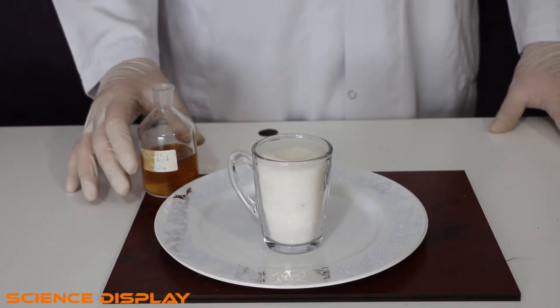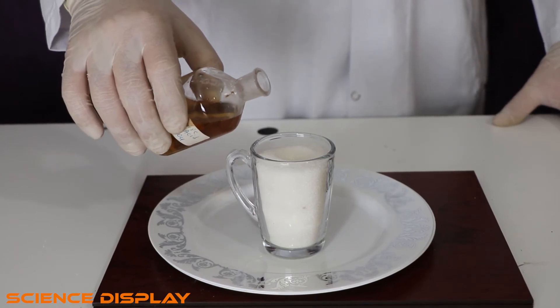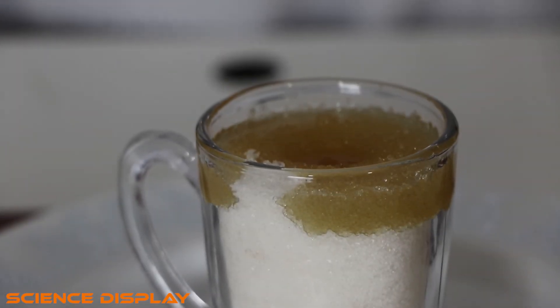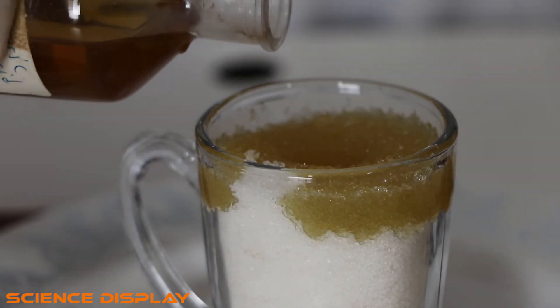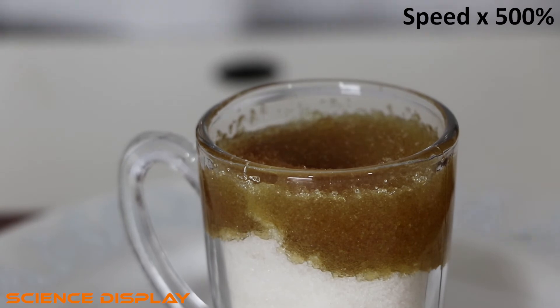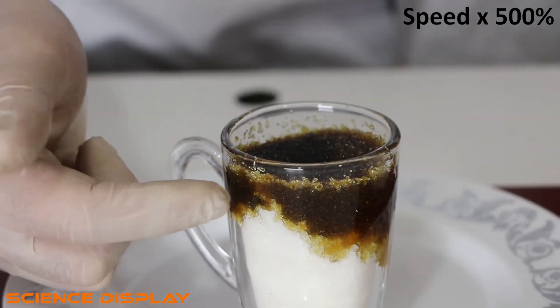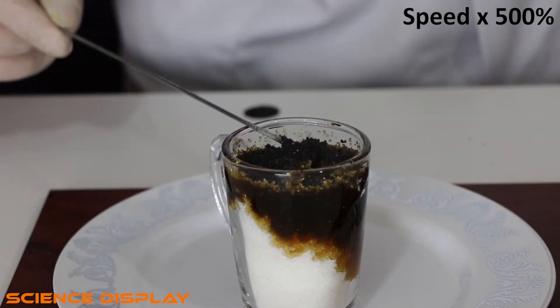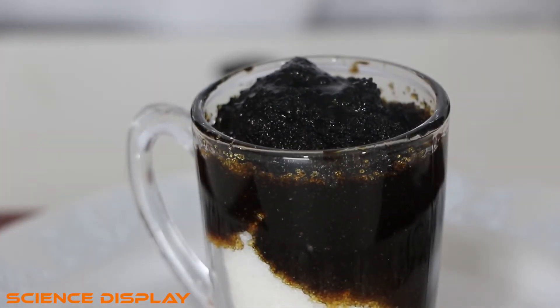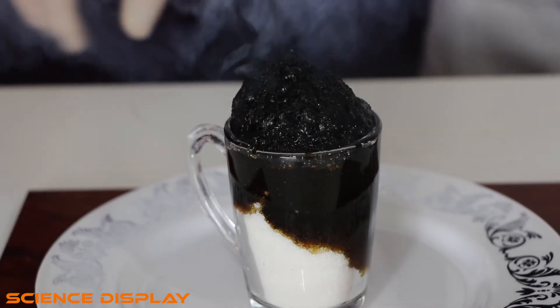Okay, now we are going to check the reaction with sulfuric acid and sugar. I am going to pour sulfuric acid on the sugar and let's see what will happen. A bit more. Oh, it's producing too much smoke — this is the most one.